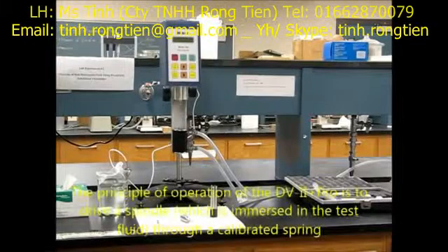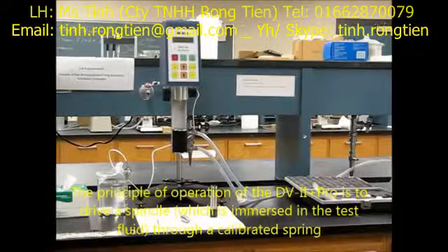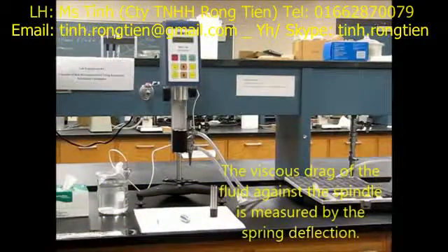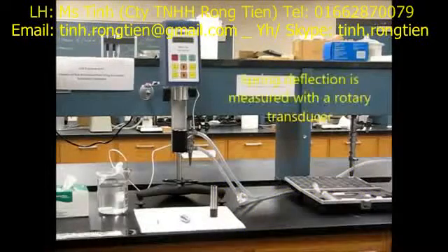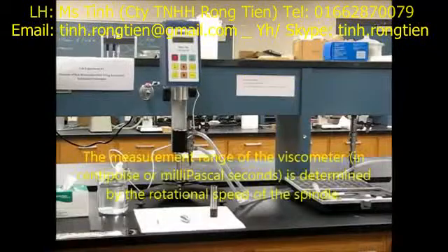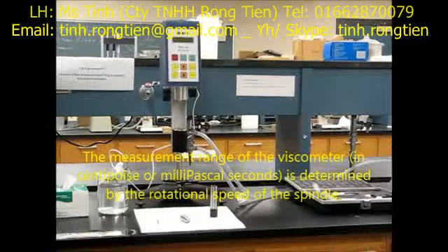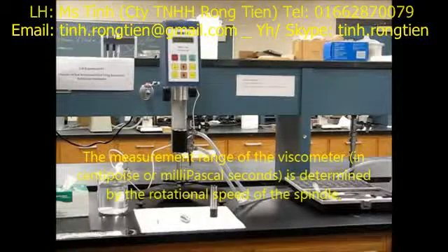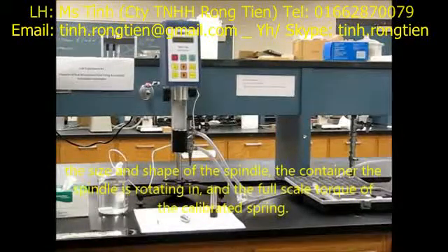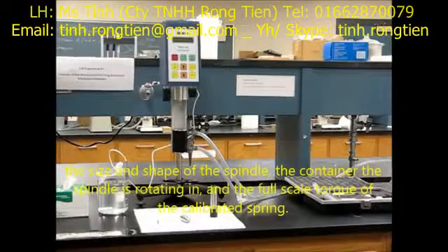The principle of operation of this viscometer is to drive a spindle through a calibrated spring. The viscous drag of the fluid against the spindle is measured by the spring deflection, which is measured with a rotary transducer. The measurement range of the viscometer in centipoise or millipascal seconds is determined by the rotational speed of the spindle, the size and shape of the spindle, the container the spindle is rotating in, and the full-scale torque of the calibrated spring.